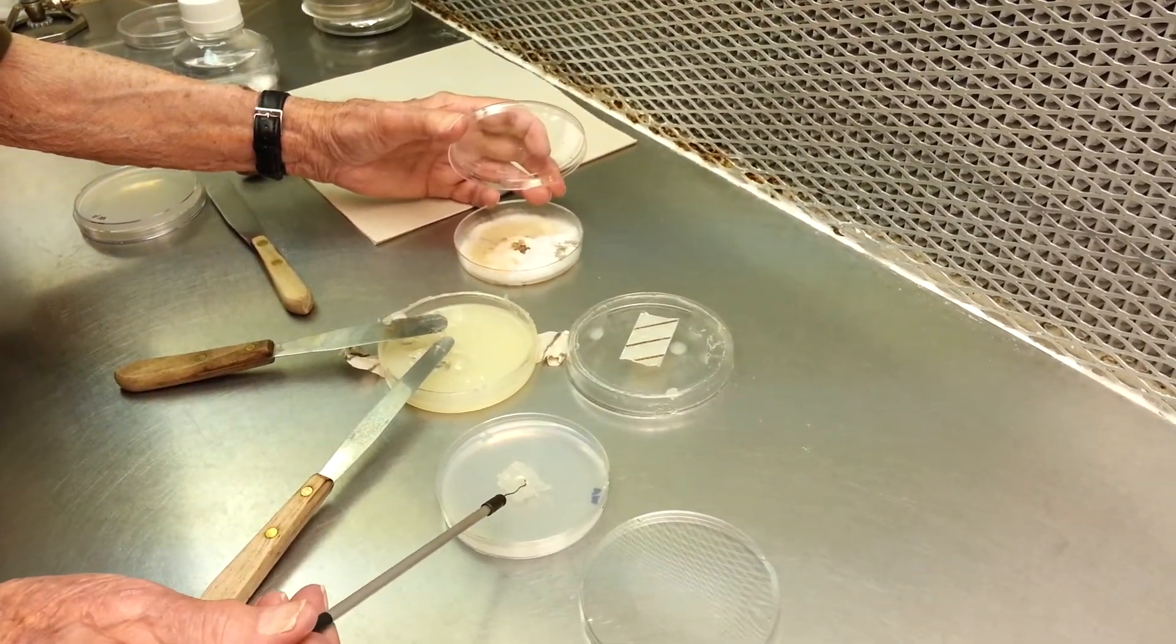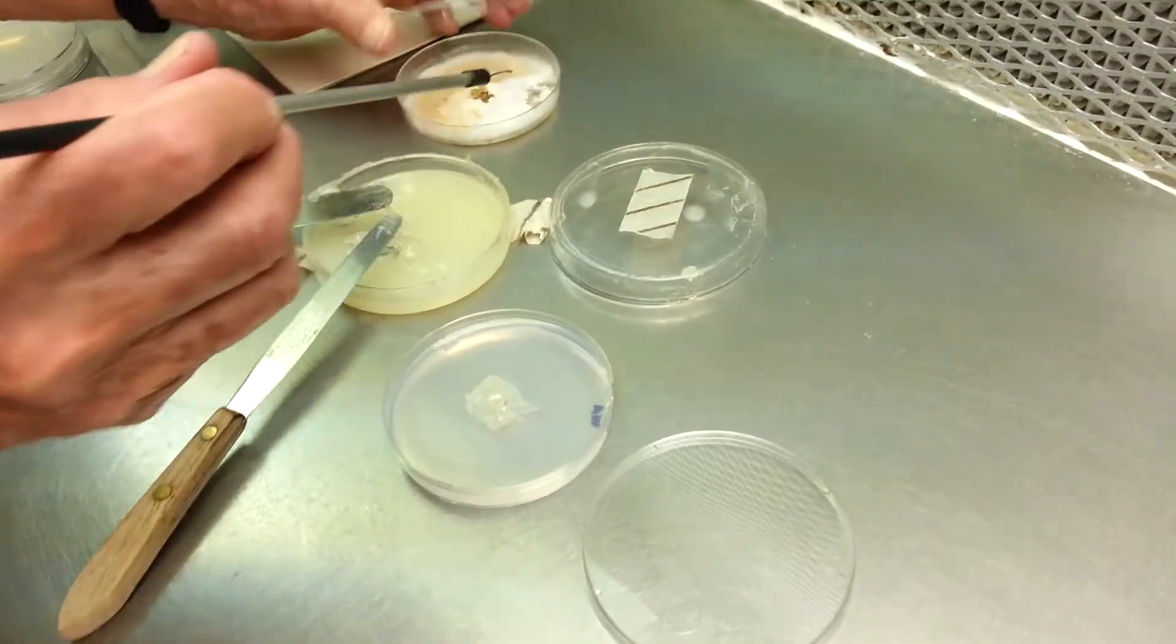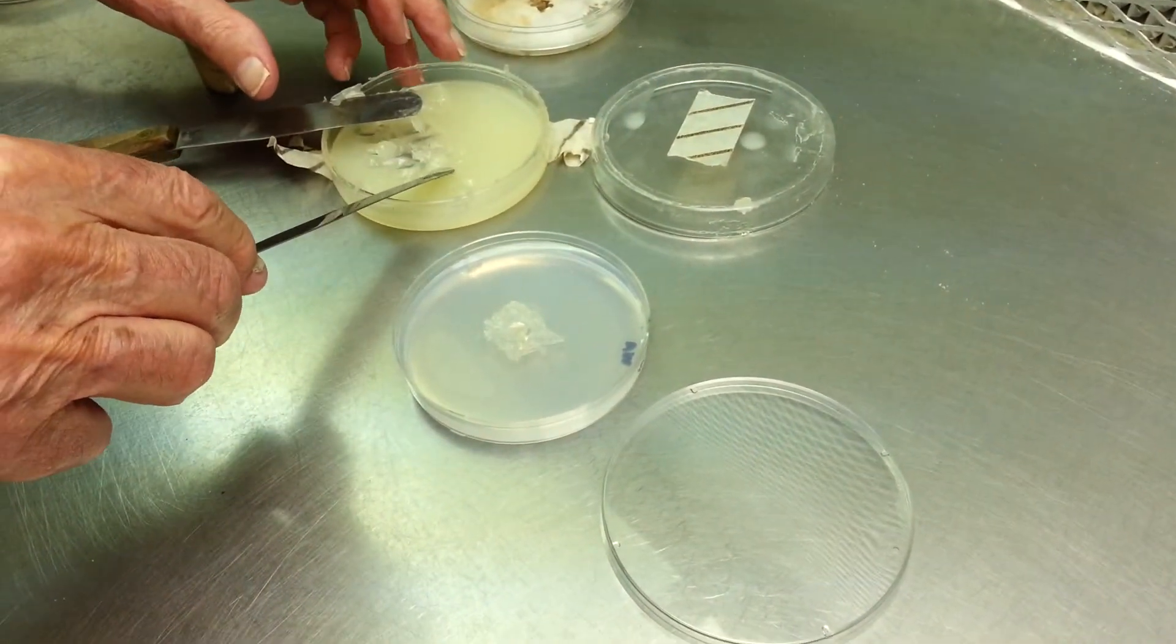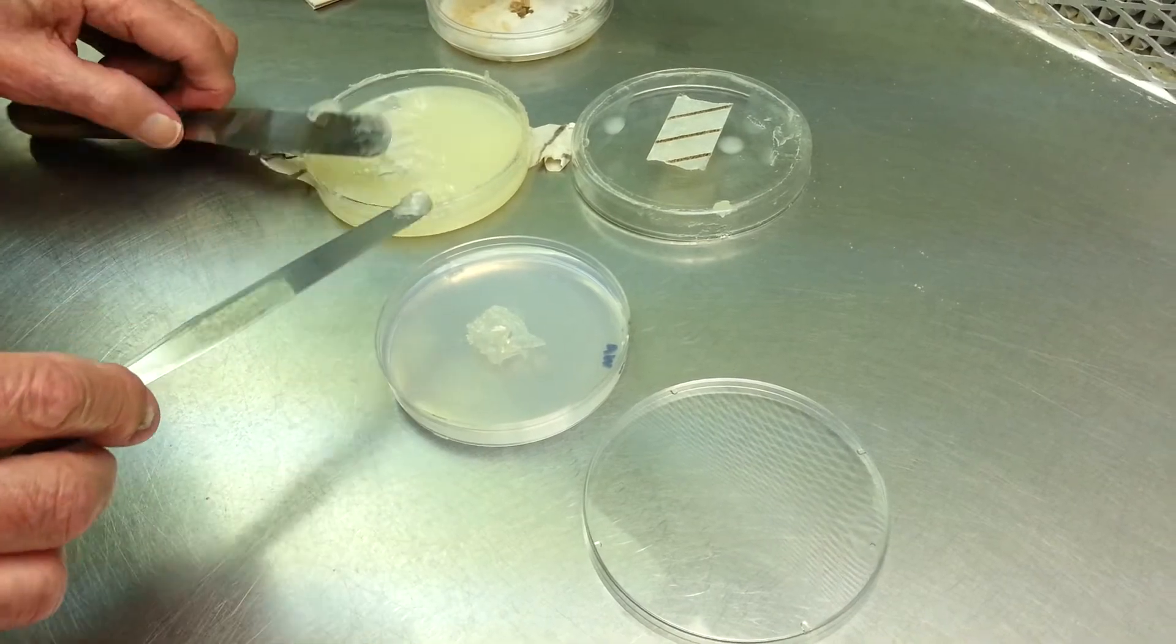Just like the scraping of the mycelium, right? Yeah. And then we cover it with another layer of Vaseline. Okay.